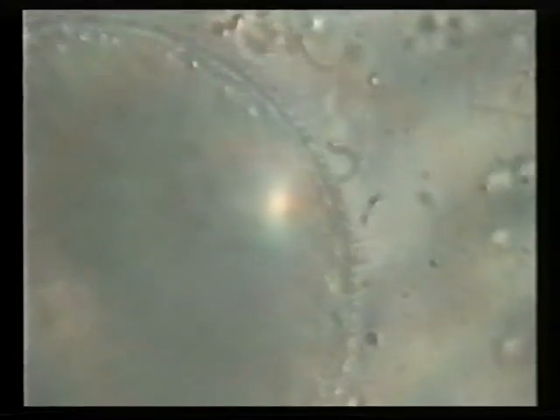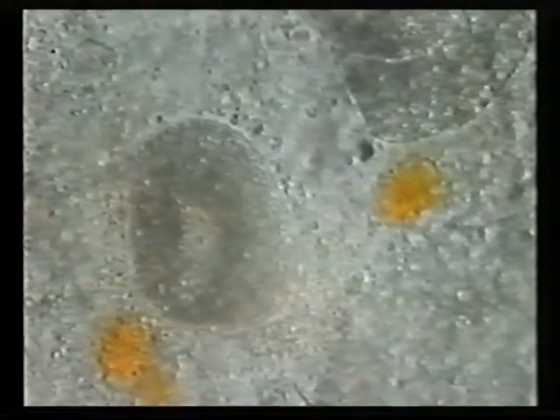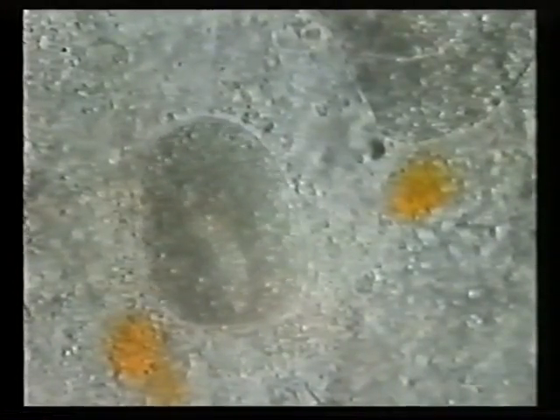Once released, they efficiently move through the water using a ring of fine cilia, which they beat profusely, and which under the microscope appear as a fine blur as seen in this view. If temperatures are favourable, this change can take place in about 20 hours. Once a swarmer finds a host, the whole life cycle starts again.